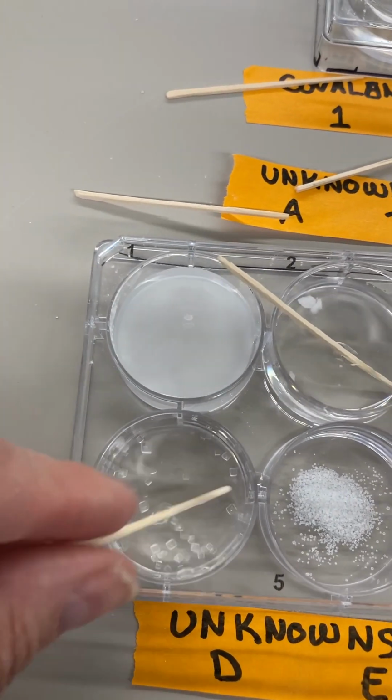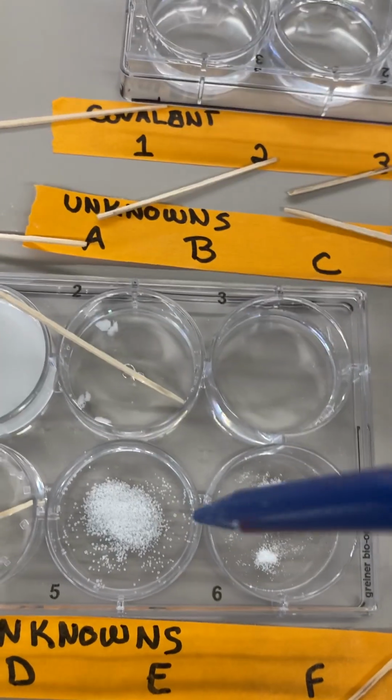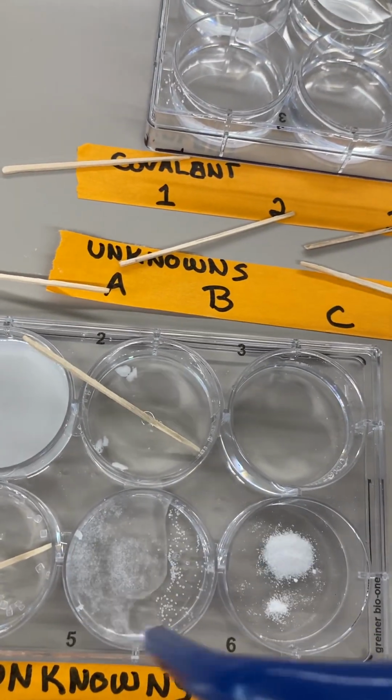I'm going to let those sit for a minute or two, and we'll go to unknown E.